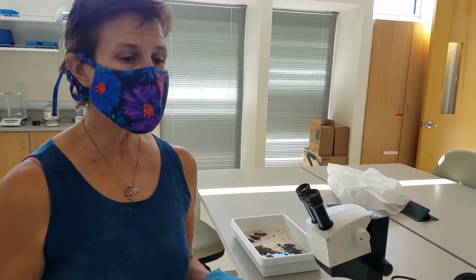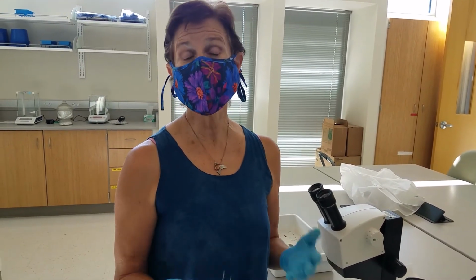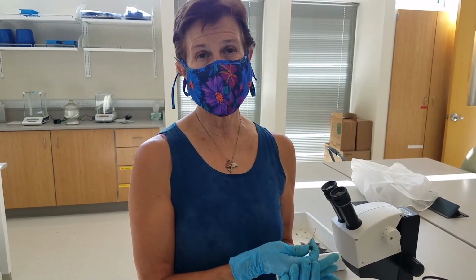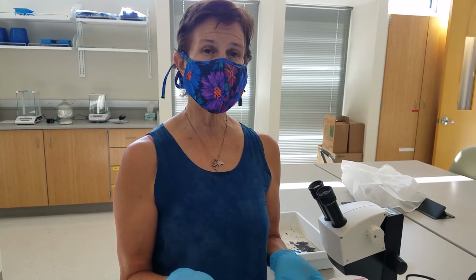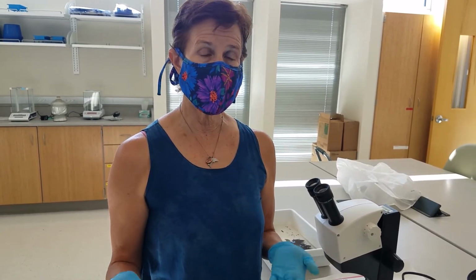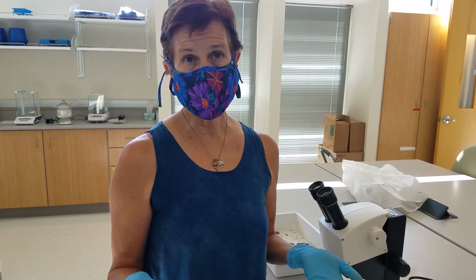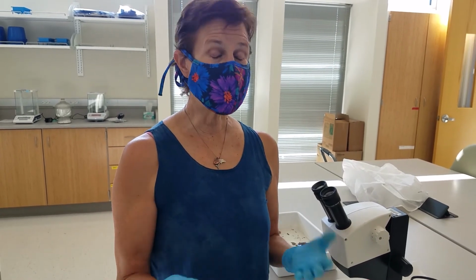When you're doing stream research in the field, you often have hundreds of samples, and so you start out with a strategy that allows you to do subsamples on each of those to do an assessment of what the potential density of macroinvertebrates was and the diversity too. So.